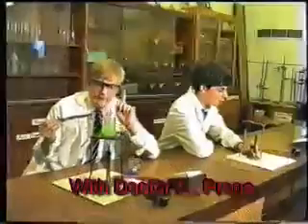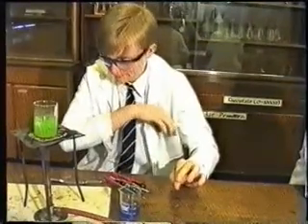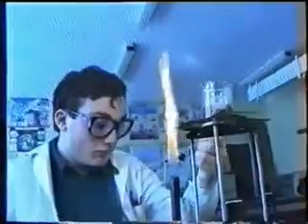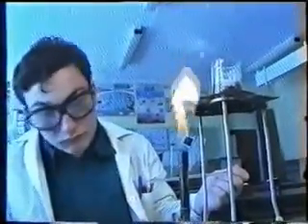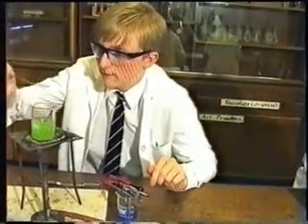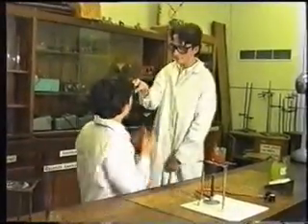Today in Safety in the Lab, we're going to look at a thorny issue which has plagued teachers for centuries. Look at these chaps here. Notice anything about them? What about him? Compared to him. Yes, that's right. Two of them are wearing safety glasses while doing experiments. This chap here isn't. And look what can happen if you don't.